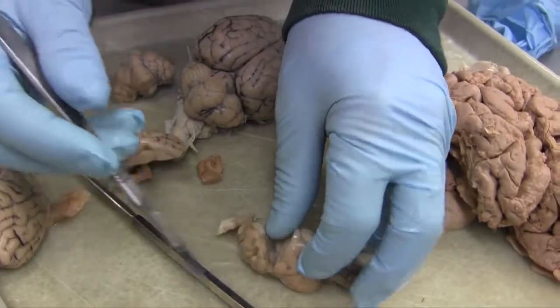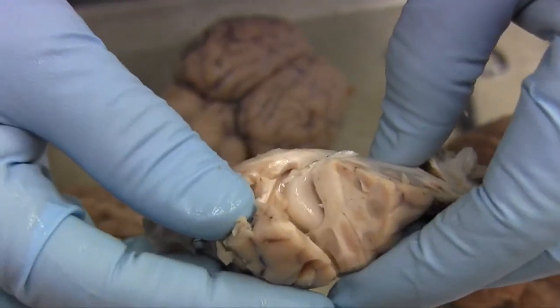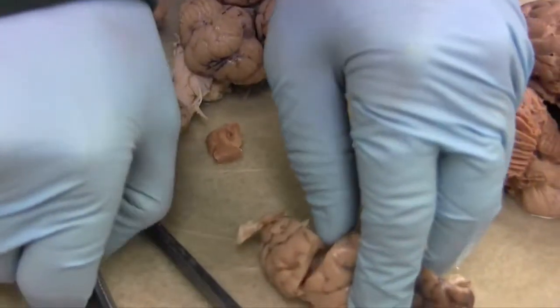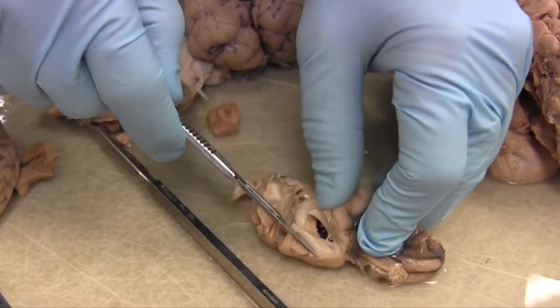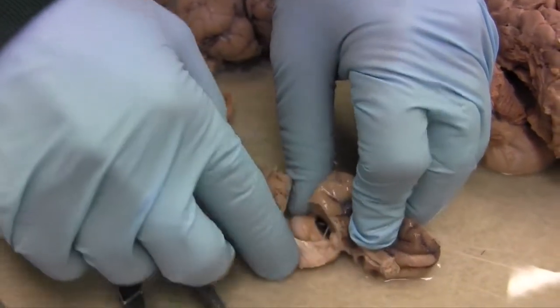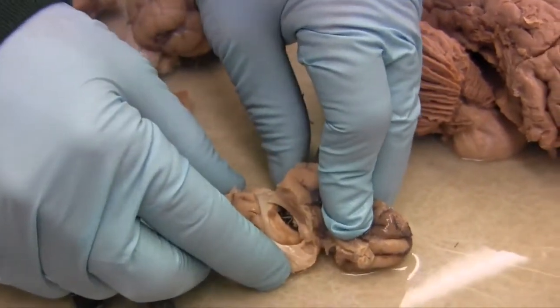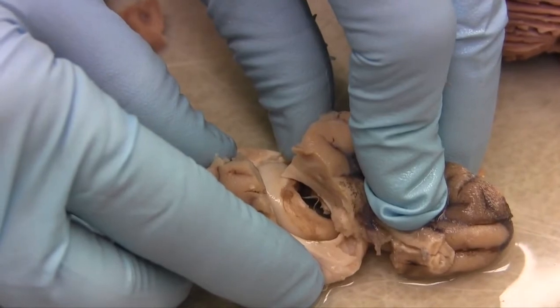Can we show it again? A little more so. Yeah. There we go. Okay, so now we're going to go like that. Oh, look at that. It's so pretty. Ooh, yes, and there it is. Sheep and human, both mammals. There you go.